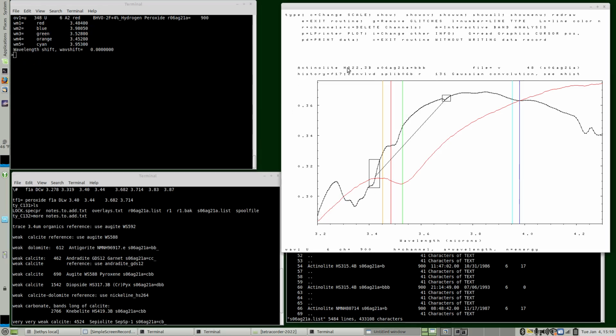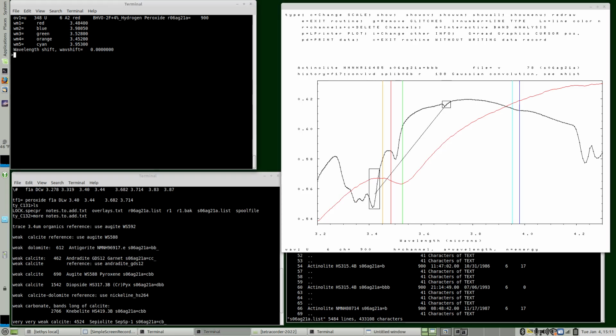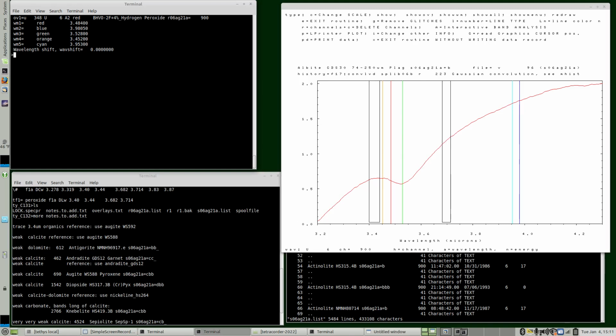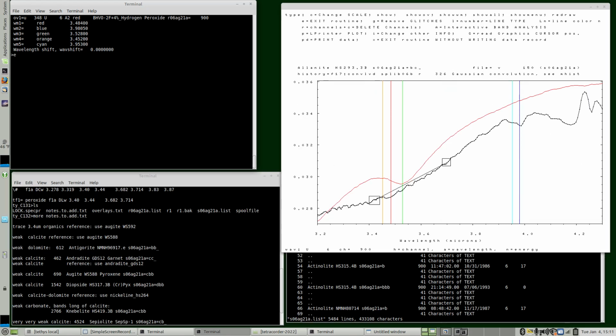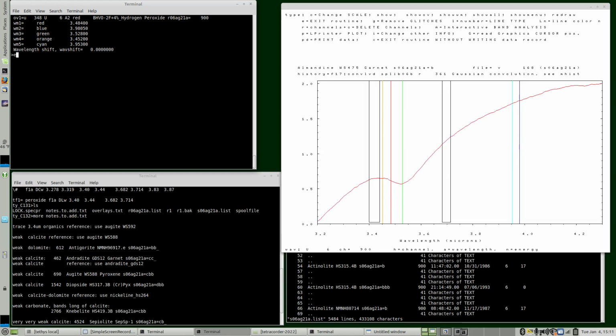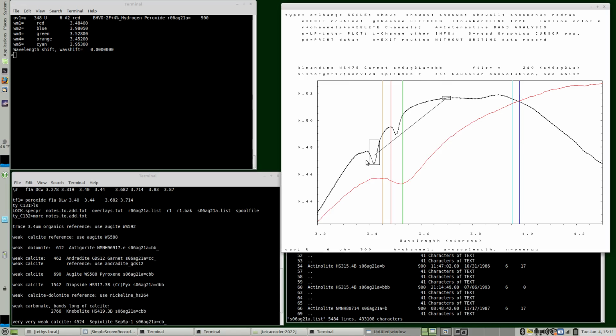And you can watch the name up here, actinolite. So we can go through these pretty quick. When nothing is shown, there's no data. It's probably an ASD spectrum, which doesn't include the longer wavelengths. And I'm just typing E return, and it pages through the spectra. So I can see what works and what doesn't. So I went through the entire library. Took a while. You can see most of these spectra, let me get to one of these. These are trace organics in the sample. So this almandine has trace organics. This is probably a few tens of parts per million.